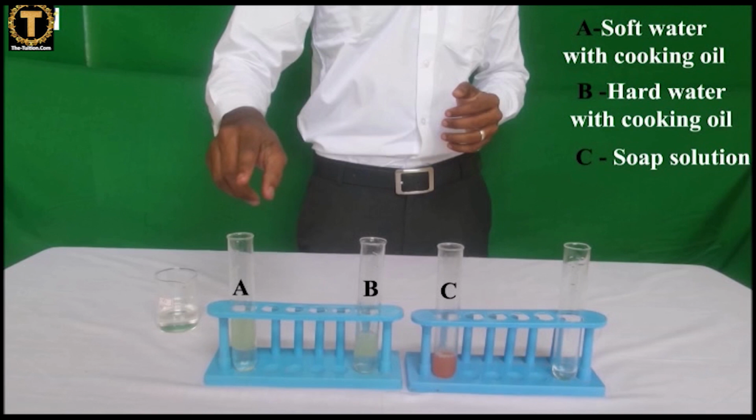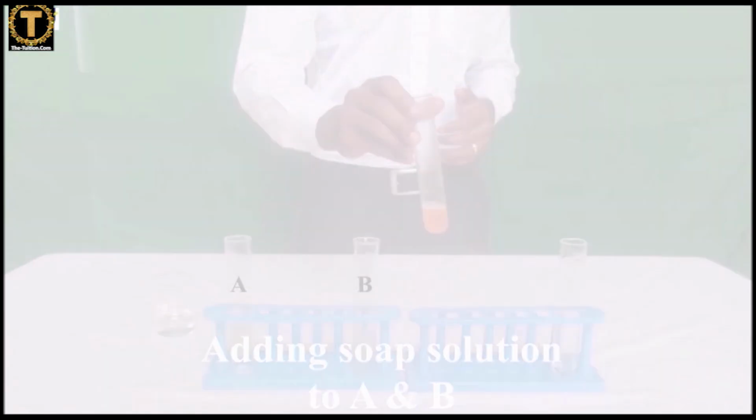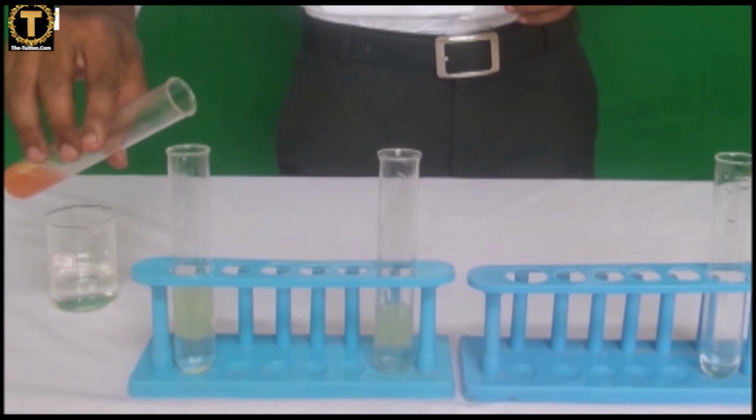Procedure. Take 10 ml of distilled water and cooking oil in a test tube. Label it as A. Take 10 ml of hard water and cooking oil in another test tube. Label it as B. In both the test tubes, add a few drops of soap solution.